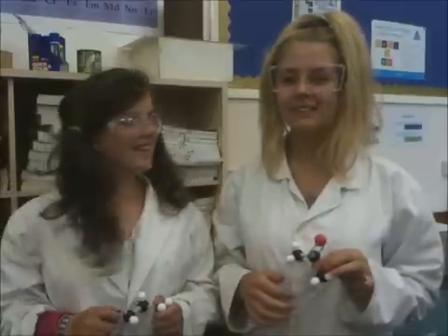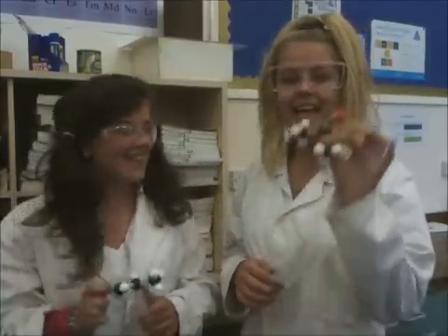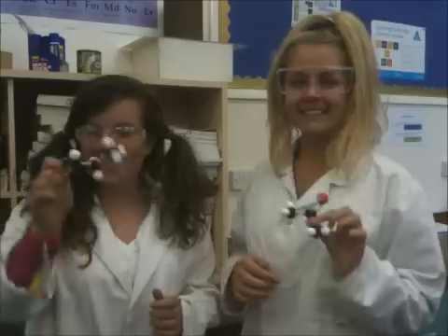Hello, I'm Sarah Sulfate and I'm Libby Lithium. We are doing a test to distinguish between aldehydes and ketones.